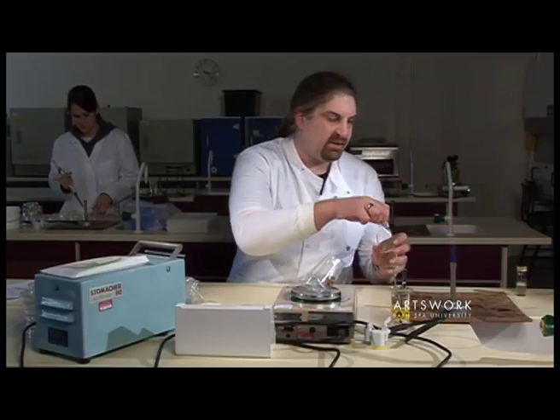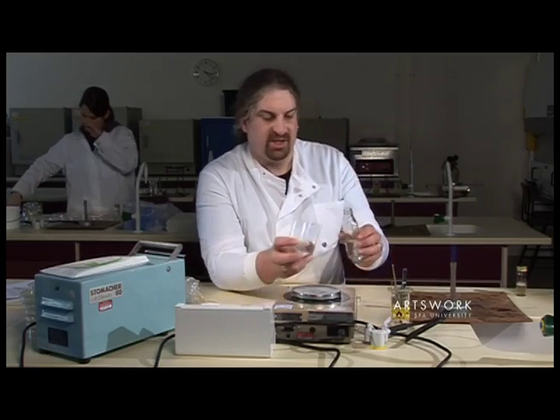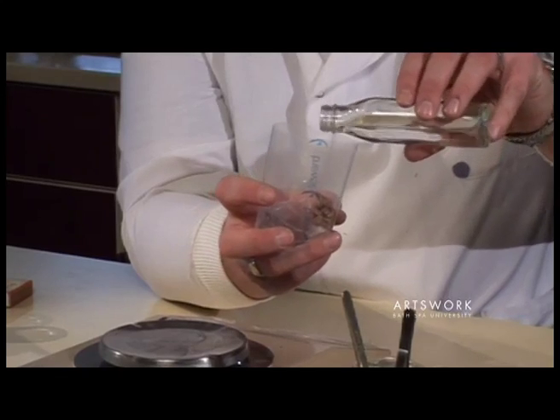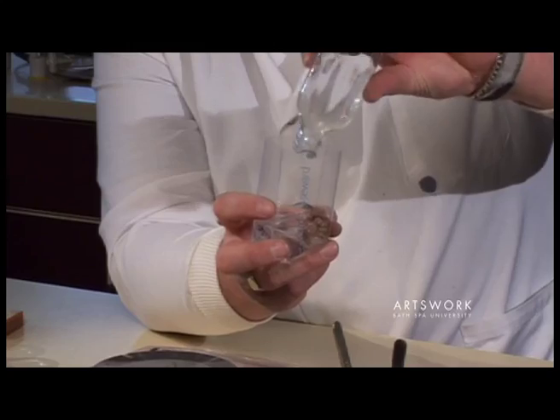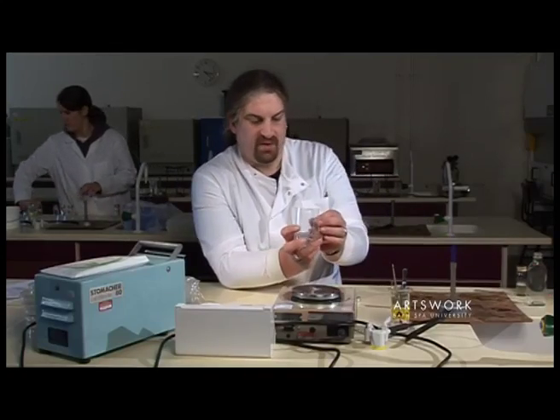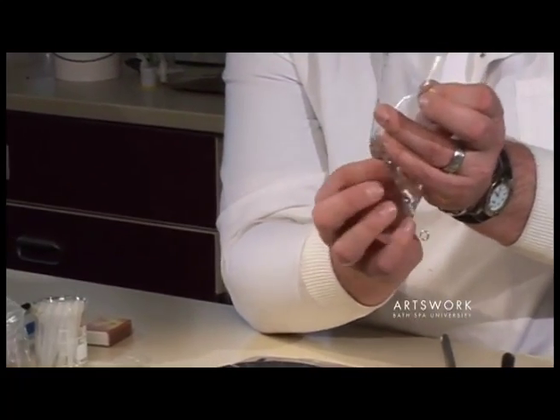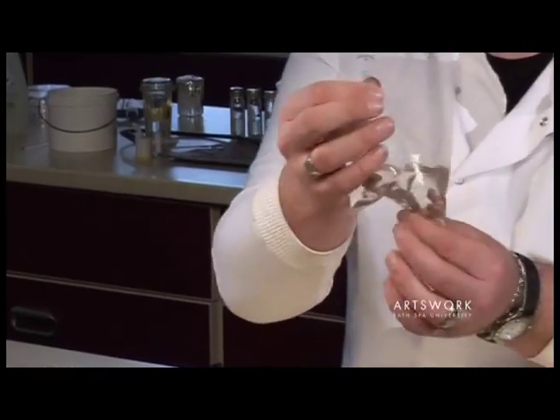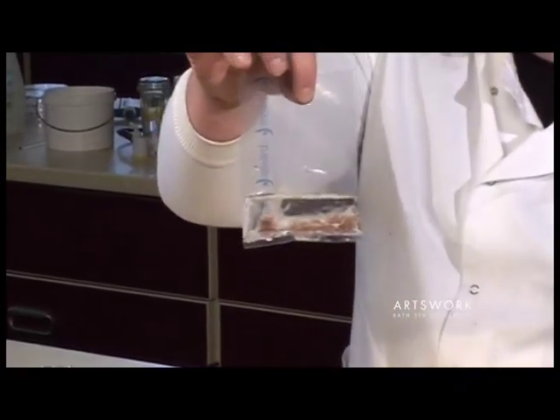You need to open a bottle, sterilise that, and then just pour that into the bag with our sample. Then just pull out the bag so you've got your sample and your 45 mils of Ringer's.